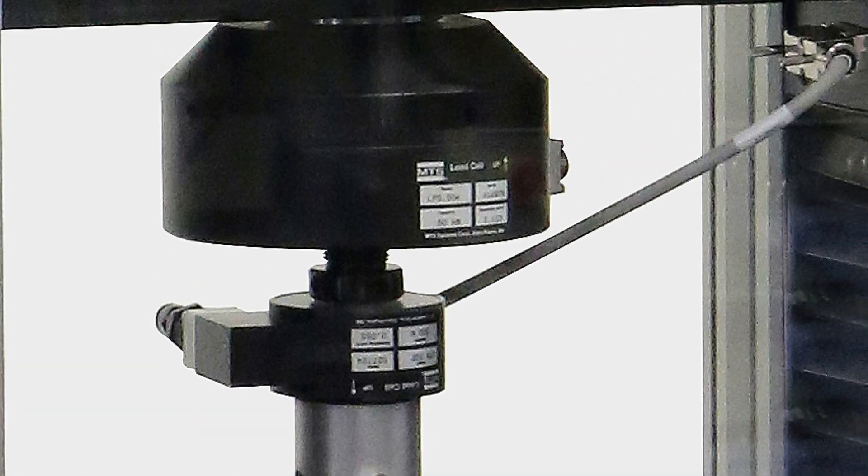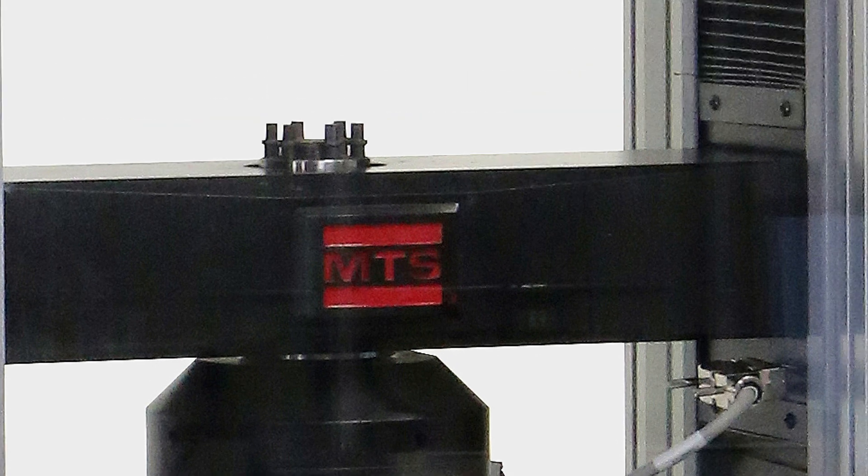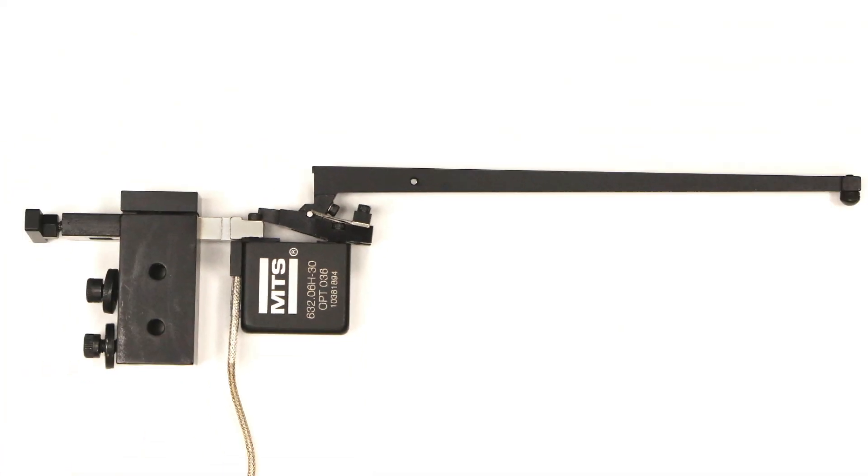To measure deflection, we will be using the frame's crosshead encoder. Alternatively, we could use MTS's 632-06 displacement gauge to measure sample deflection.